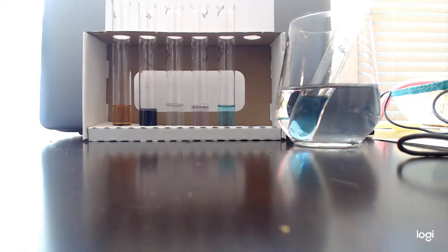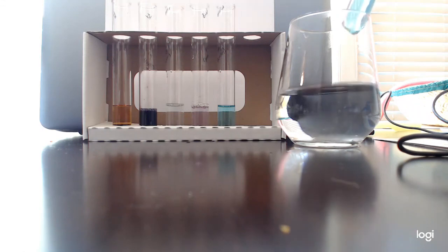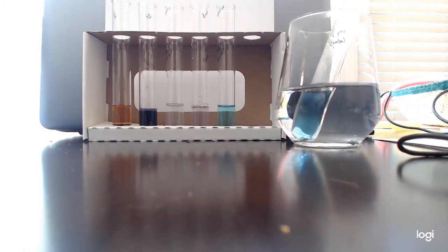Might have. Oh, maybe that'll do it. Maybe. I think I'm just precipitating sugar, guys. Maybe I should be patient. Maybe I should put more Benedict solution in. We're going to figure this one out, y'all. We're going to figure it out.